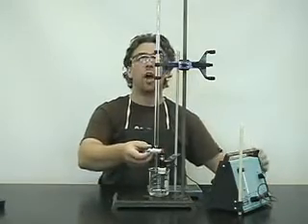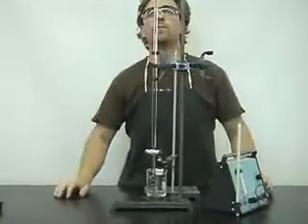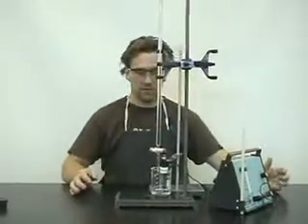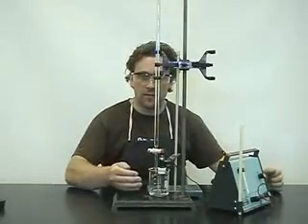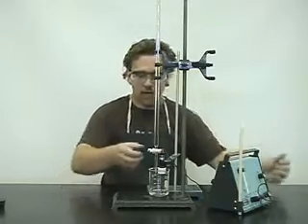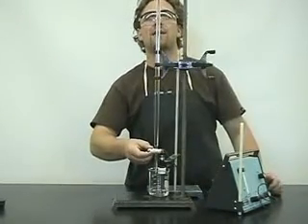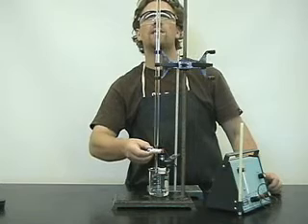Let's just start. Our starting volume is 10 mils. In other words, zero mils of sodium hydroxide added, pH of one. We're going to go ahead and add five mils.